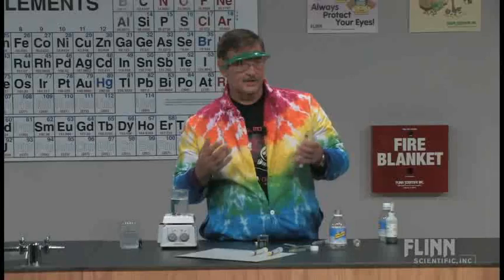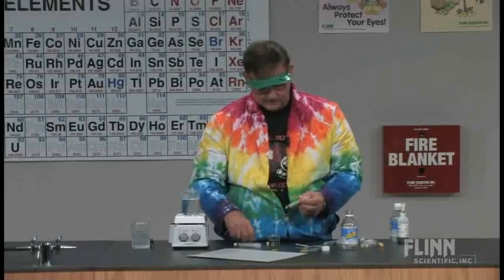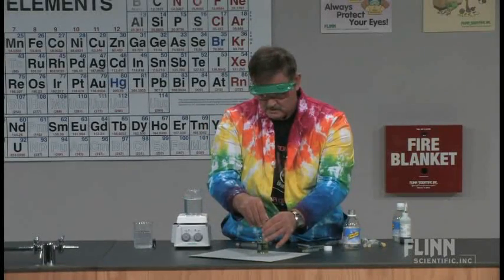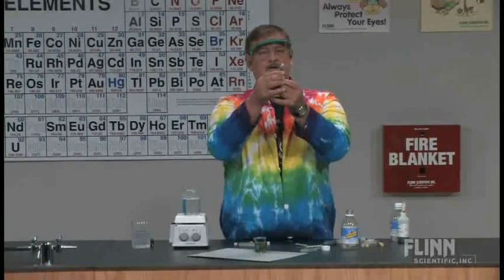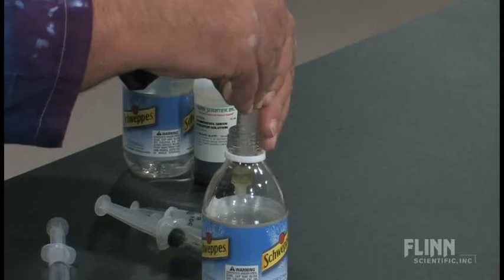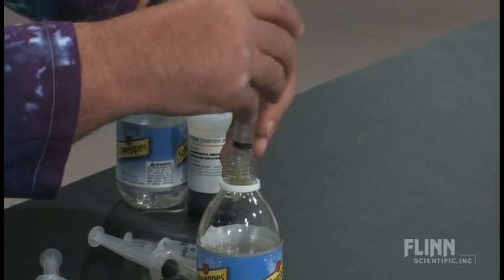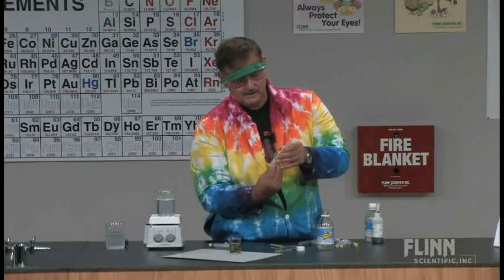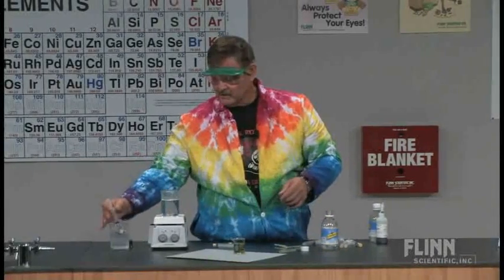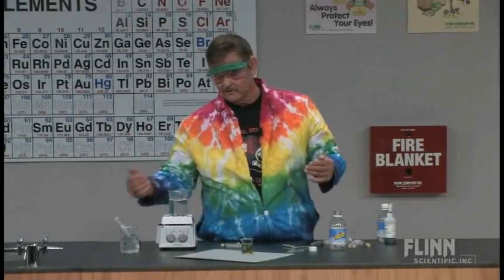The second thing you can do is a temperature component. They can also take a look at how the solubility of the carbon dioxide changes with temperature. So I've got a couple more syringes, and I'm going to put about two milliliters of the original solution in, then draw up about three milliliters from the seltzer bottle to about five total. I'm going to cap it and put one in ice - we'll leave that there and take the temperature in a minute.